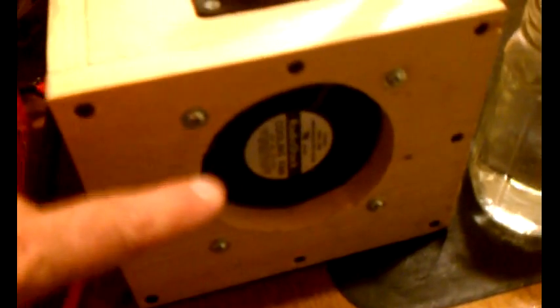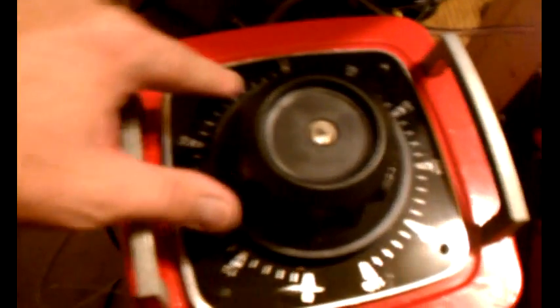I've also got a fan installed which is actually running right now. This side has got the filter with the air flow coming through. Over here's my hookups coming around here to the variac, which variacs are an adjustable power supply and go into the wall.